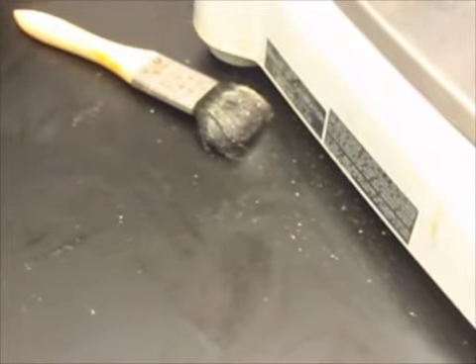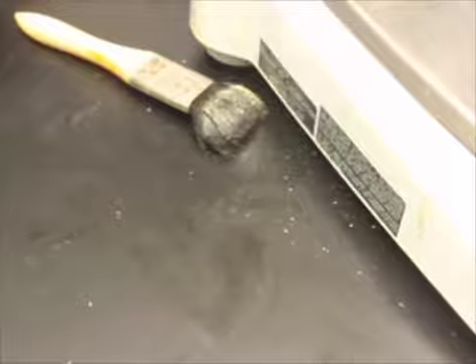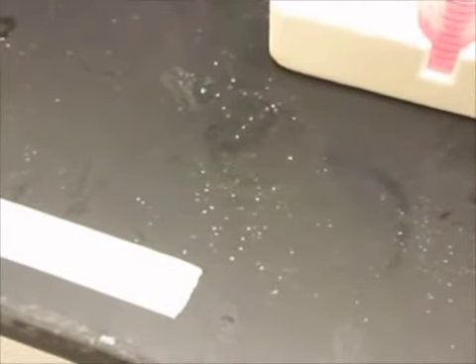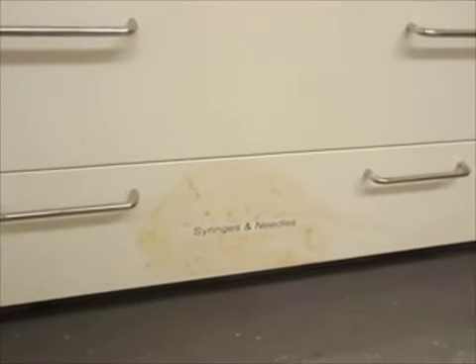Though I'm no scientist. And those are just the messes we can identify. A scientist using this balance might be interested to know what this white powder is actually composed of. Same goes for this powder by the sink. And for the love of all that's good and holy, what the heck is that?